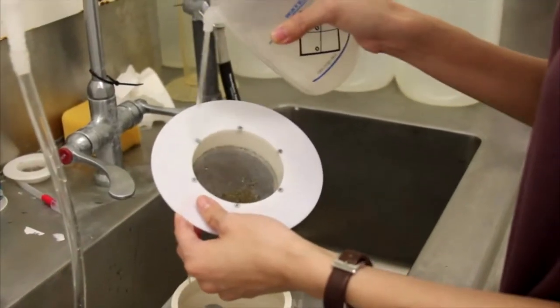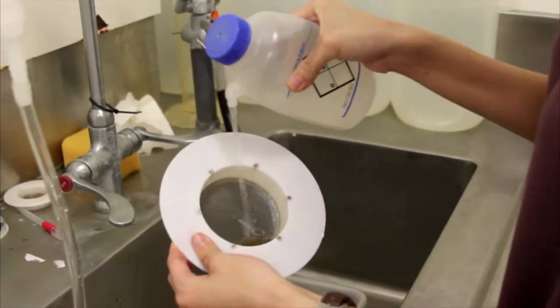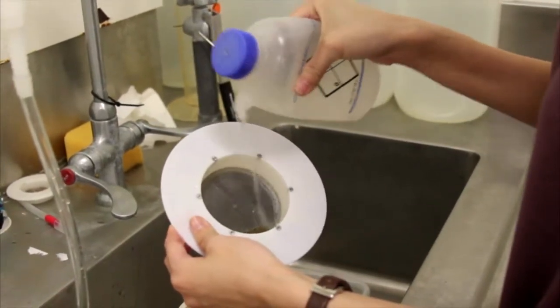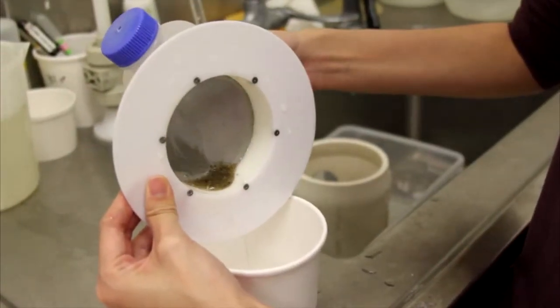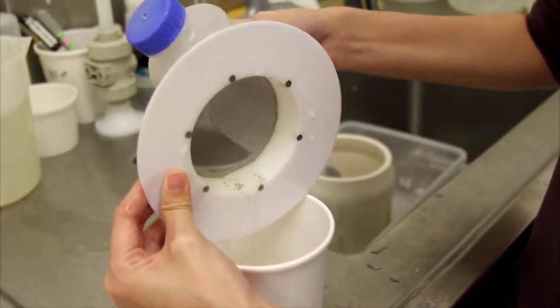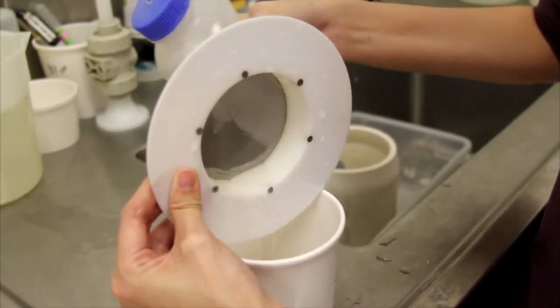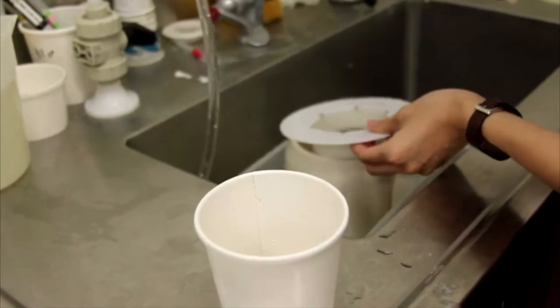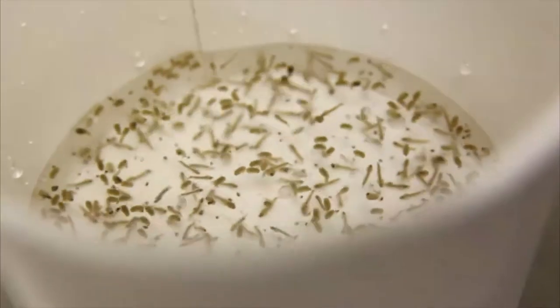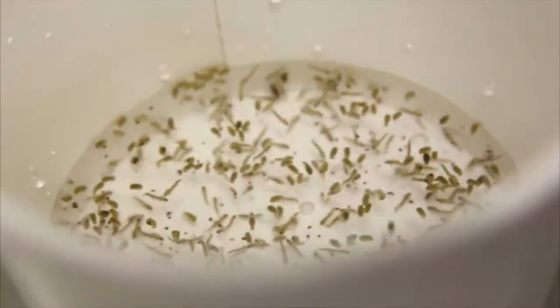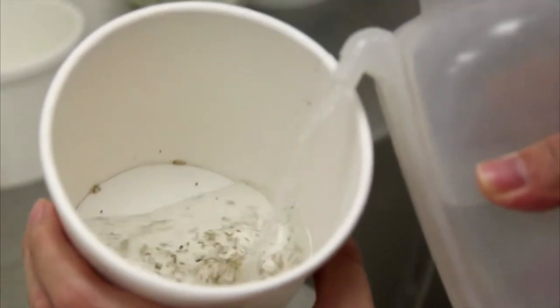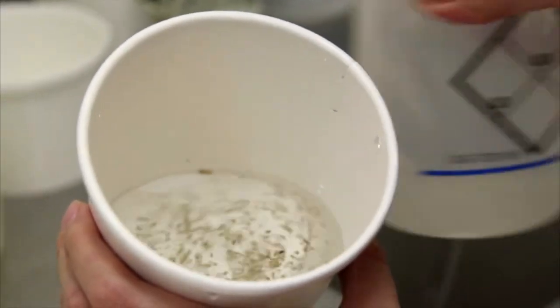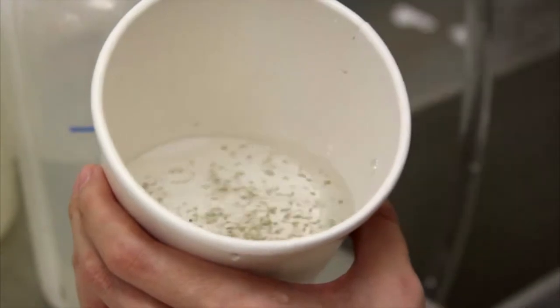Use a bottle of DI water to transfer larva and pupa from the strainer into a cup. Swirl the water around to separate the larva from the pupa. The larva will congregate at the bottom of the cup, making it easier to pipette them out.